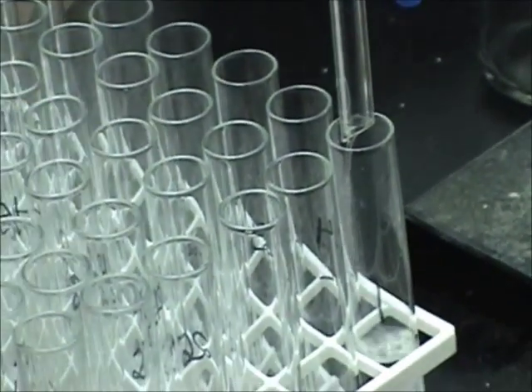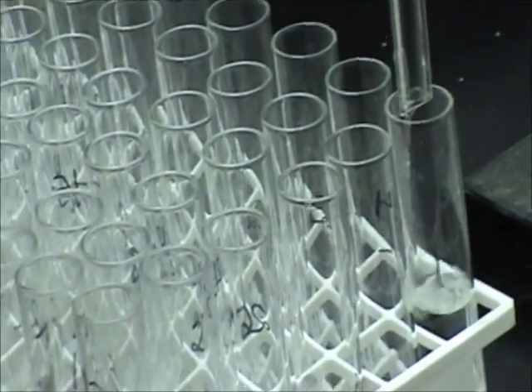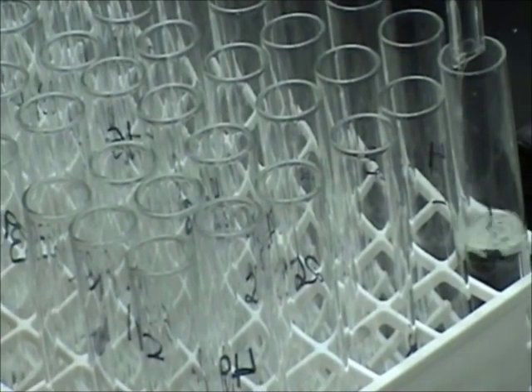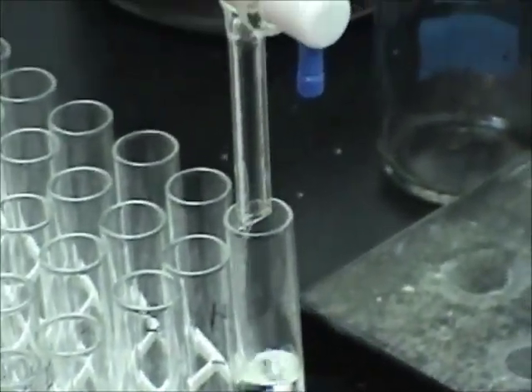We're actually running the sample through the silica and collecting it at different volume intervals to collect different fractions, because they all run at different rates. Smaller particles will go faster, but it also depends on their polarity and what they're attracted to in the silica.